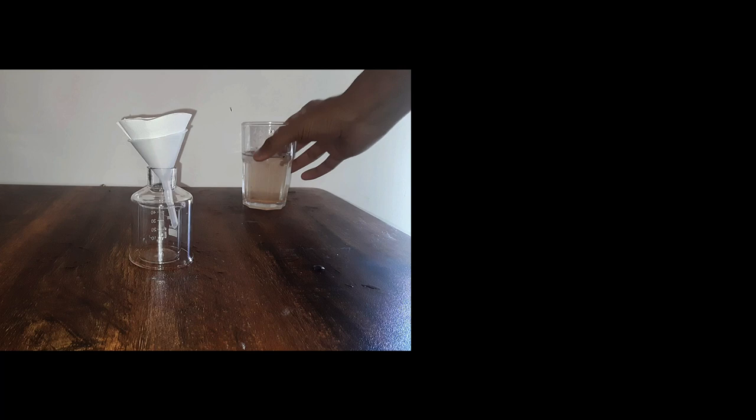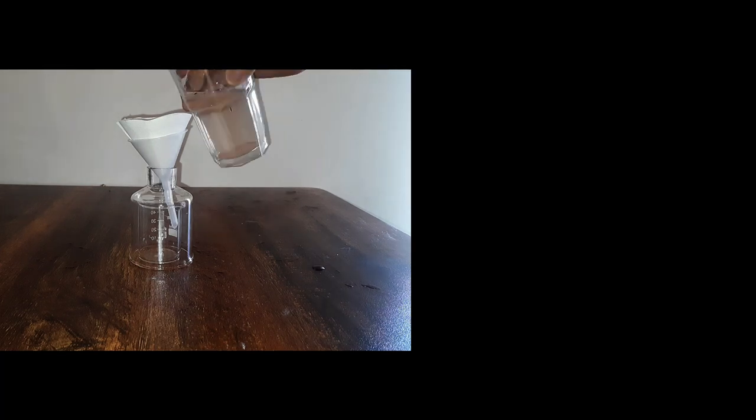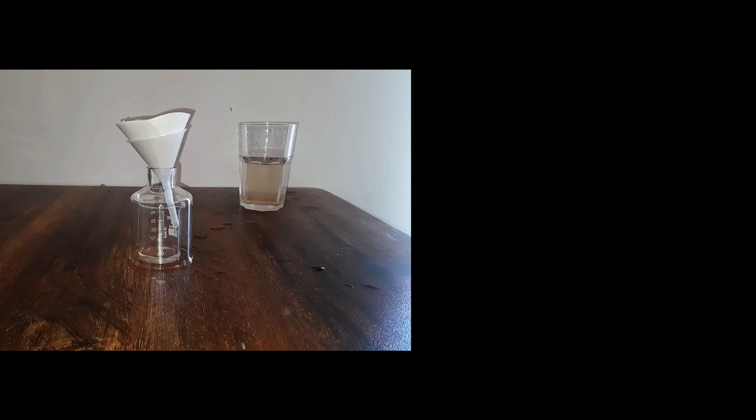Now how to carry out filtration? Let's have a look at this. We can pour the mixture of sand and water onto this filter paper that you can see is fitted in a funnel. I have something near the bottom of the funnel which can collect the water that comes out.